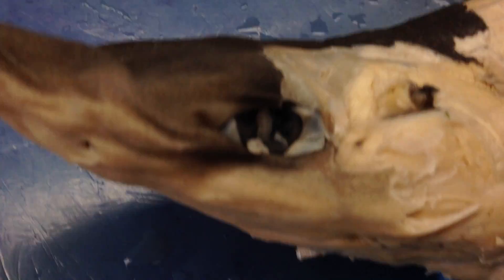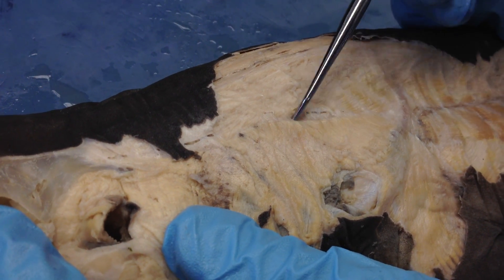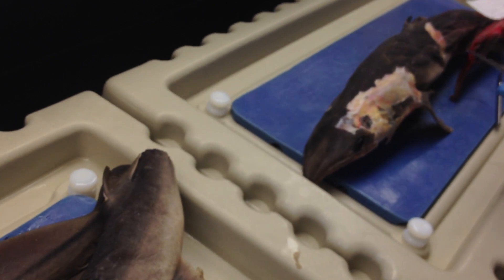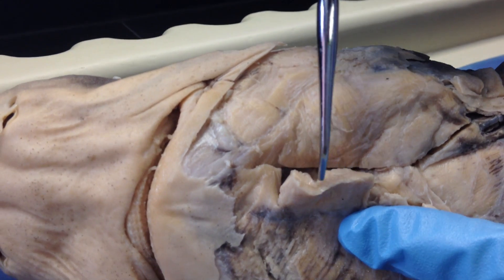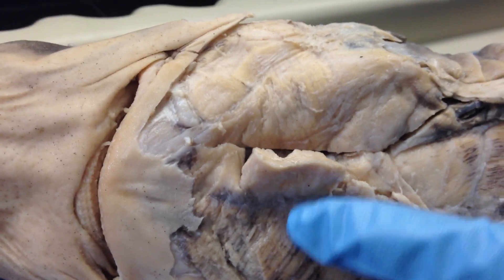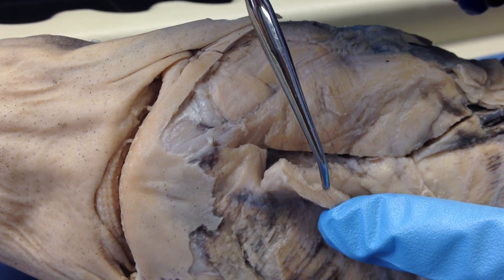In comparison, just looking at our shark — which is significantly smaller — our cucullaris is faintly right here. The intermandibular on our shark is its first layer. The interhyoid muscle is right here, right above the intermandibular.